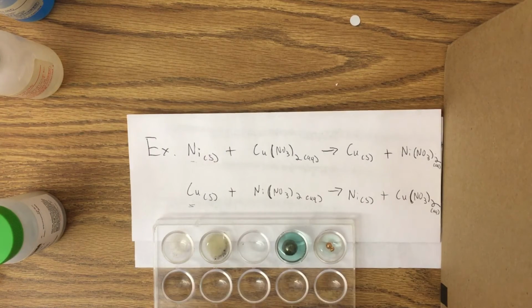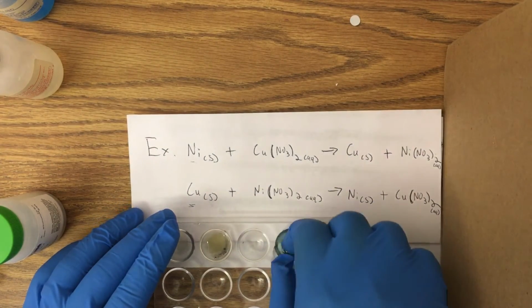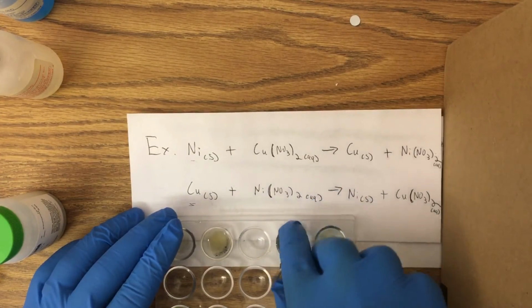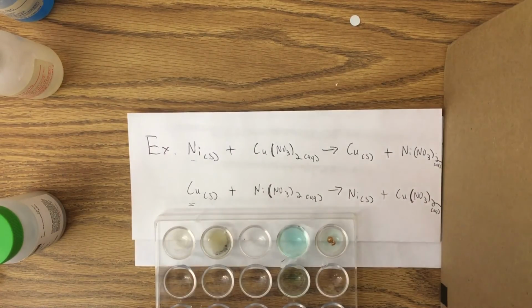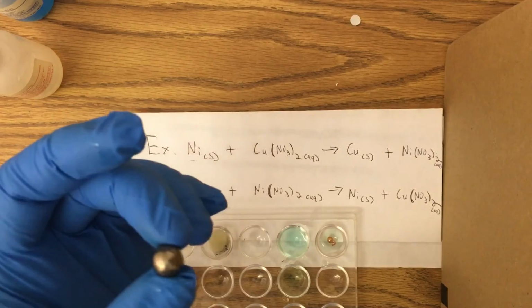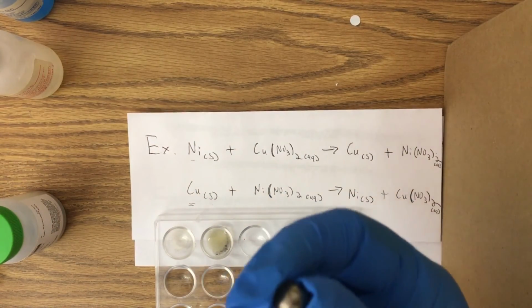So we'll take a little look at these metals after a couple of minutes and see what has happened to them. I think I'm already seeing a little bit of change with this nickel. So let me see if I can't pull it out here. And voila. What we see is this piece of nickel is very different than the nickel that we started with. In fact, there's a layer of copper deposited on the surface of the nickel.